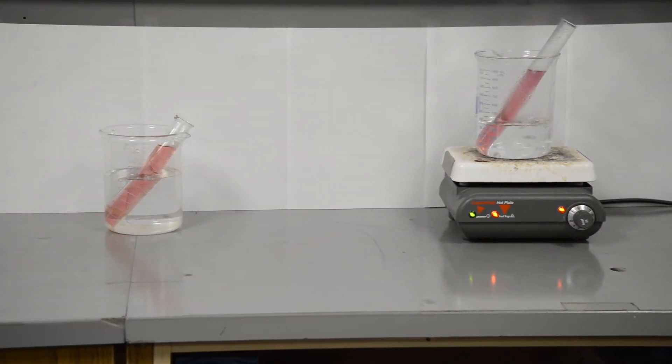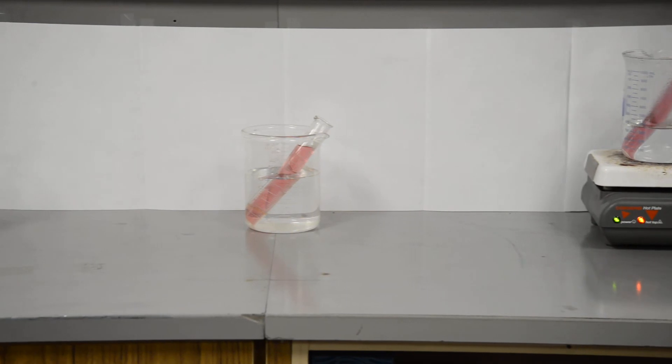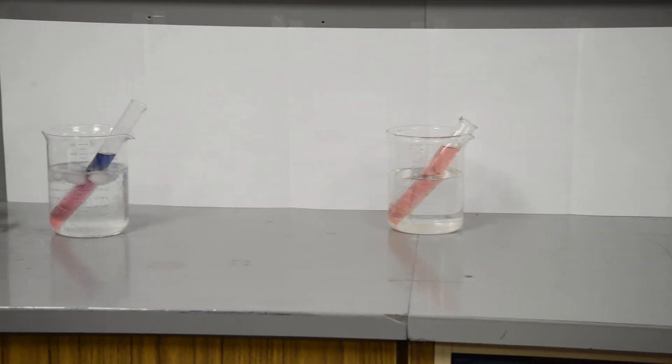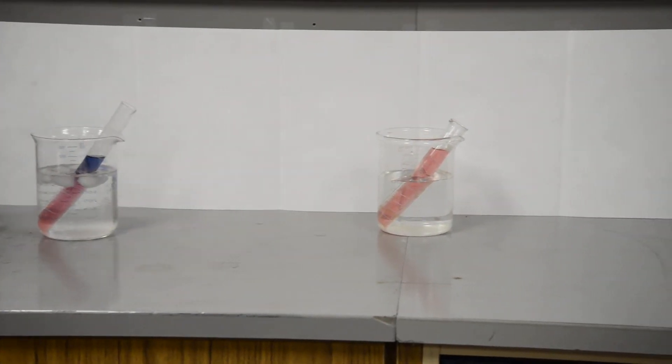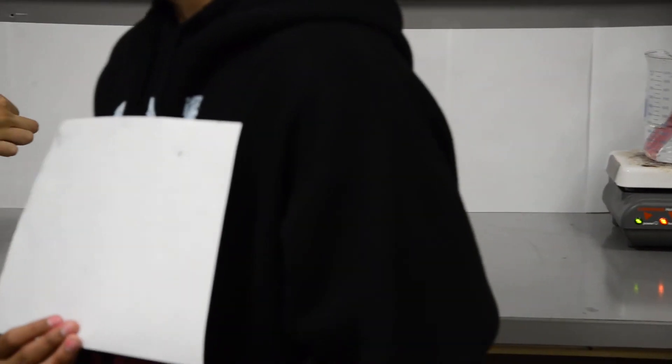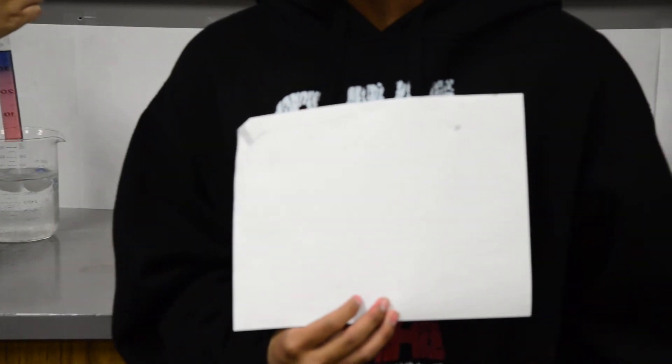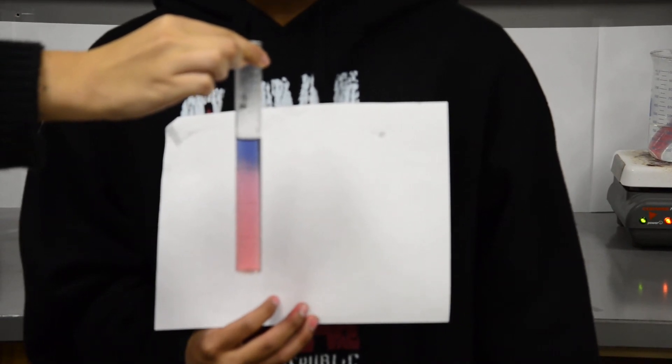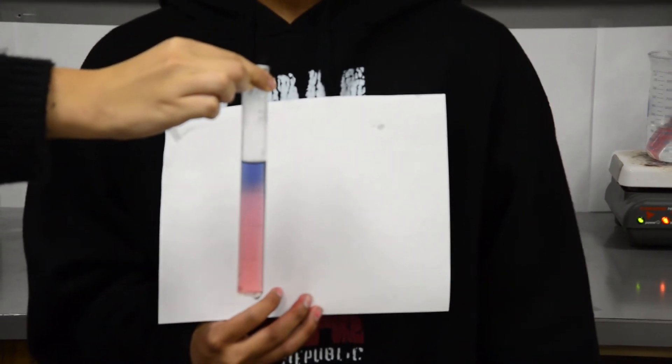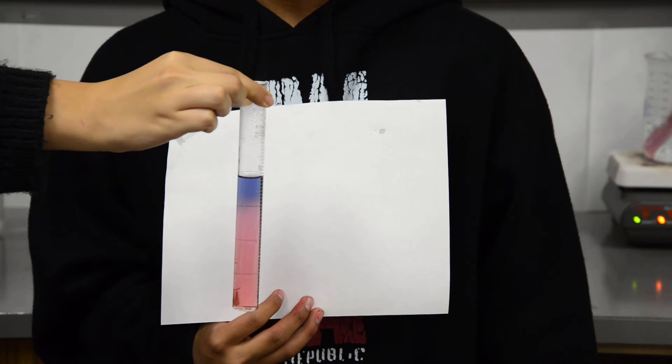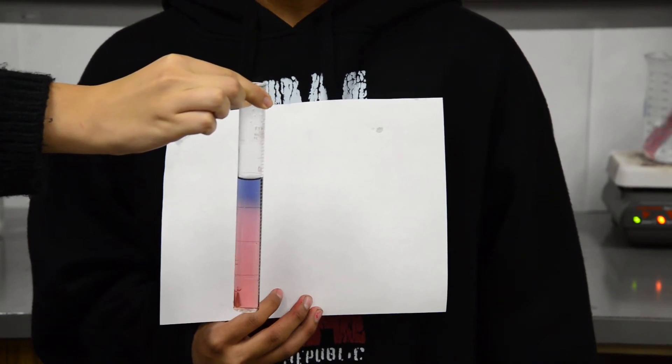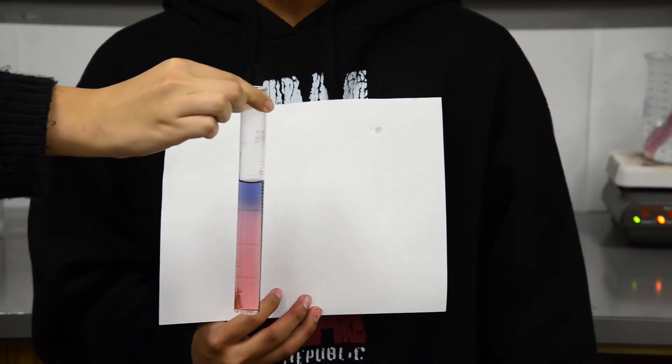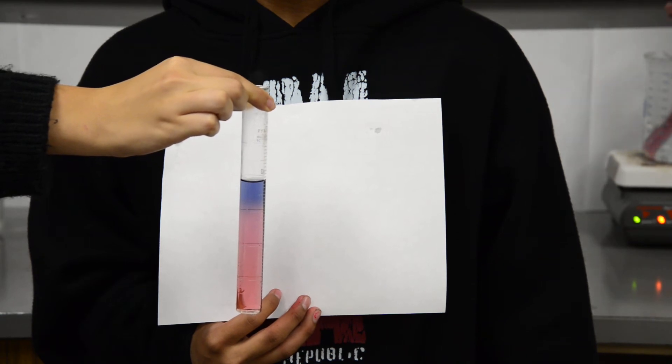If we watch this for a little bit... Kendrick, would you step in the middle again? Let's take the tube out of the ice water bath and put it up in front of the white. You can see the pink on the bottom and the blue on the top.